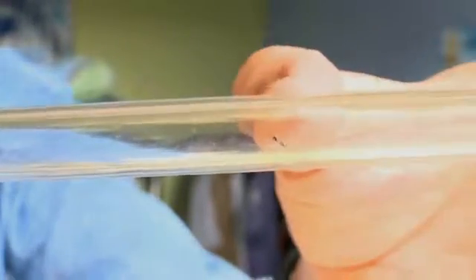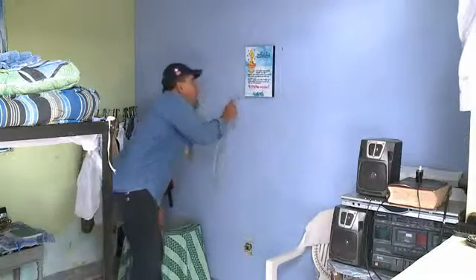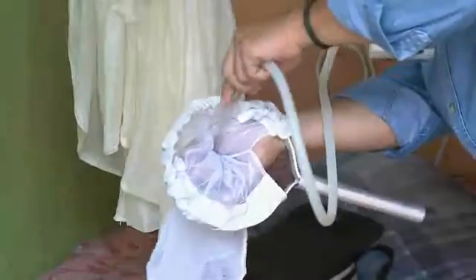No more than 5 mosquitoes should be collected in the sucking tube before transferring to a paper cup. For better conservation, avoid storing more than 20 mosquitoes per cup. Aspirators can be used for human landing collection and indoor or outdoor resting collection. Depending on the type of information desired, you can also use mechanical aspirators or handheld nets.